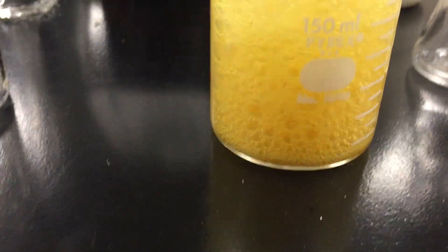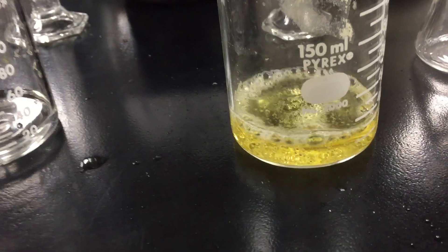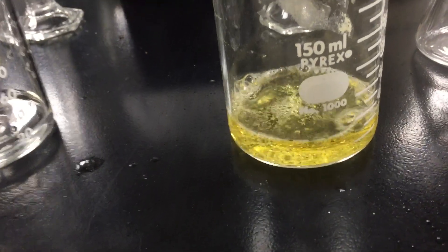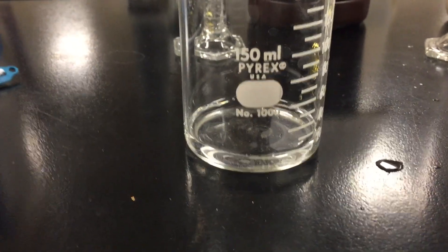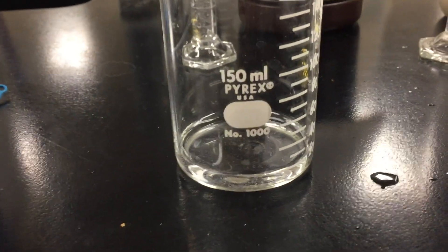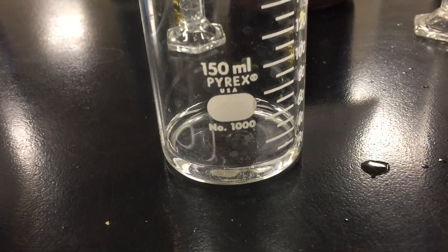We get the brown color there, and that brown color is the result of I2 being formed. But essentially it's the iodide ions that react. And there we go. The hydrogen peroxide is now completely decomposed to water and oxygen gas, while this one is still slowly reacting. It might take 10 or 15 years for that to eventually decompose without the catalyst.